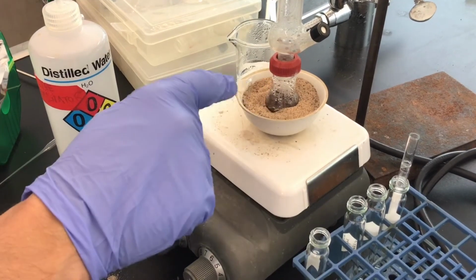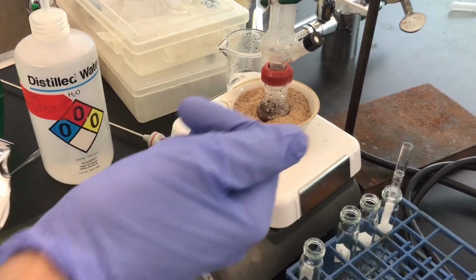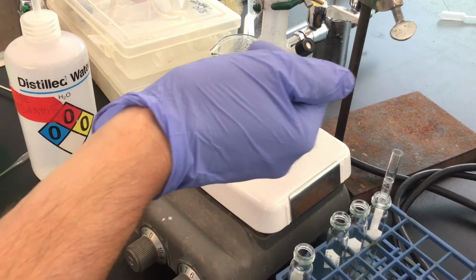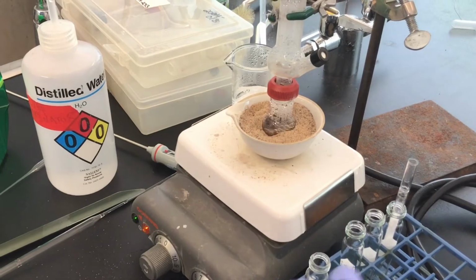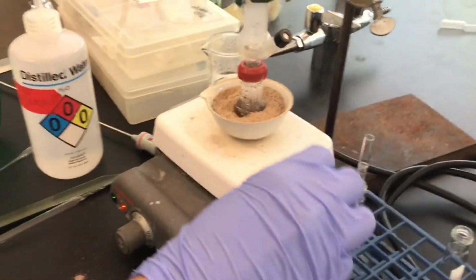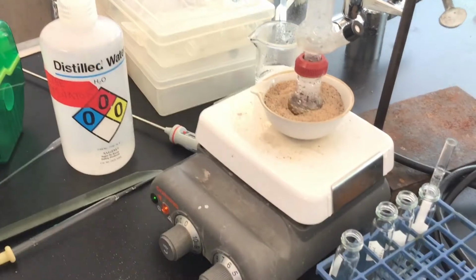We don't want to have a volume greater than what we had originally observed, because once again, that bumping effect that I had mentioned, it could superheat and then actually literally bump upward, and then some of the bark could reach this area instead, and it doesn't work out in your favor, obviously, because you want milky distillate to look like this. You don't want to have brown bark carry over, and that's a very common issue when you begin to use the foil and then you leave it on there, or if you add too much water. And so this is good.